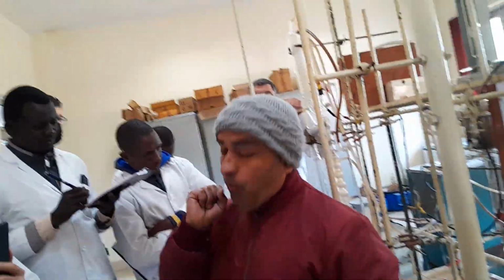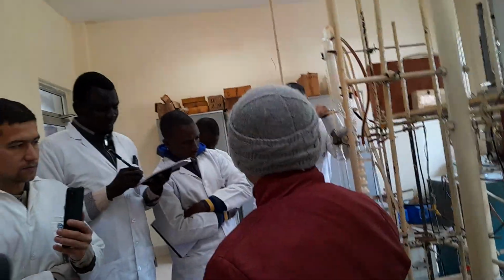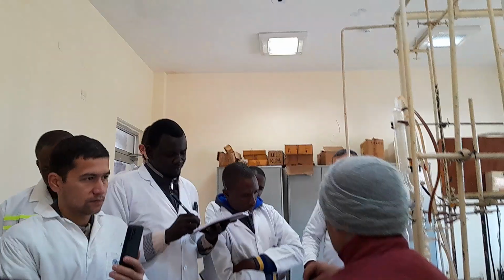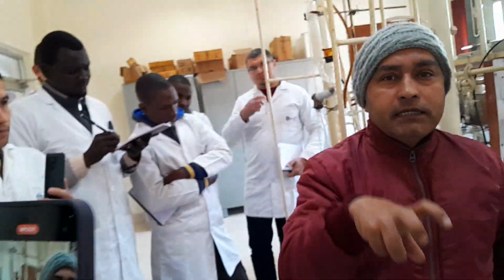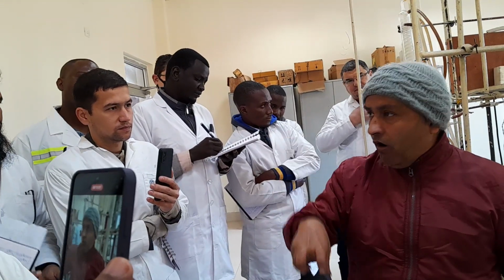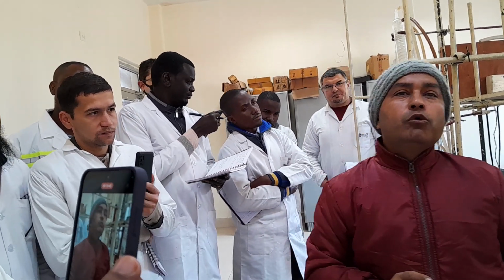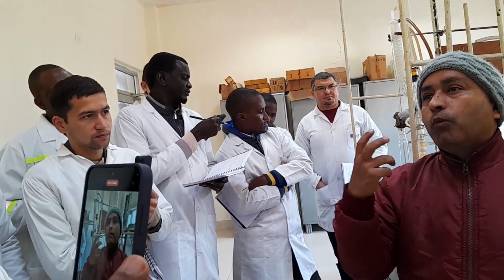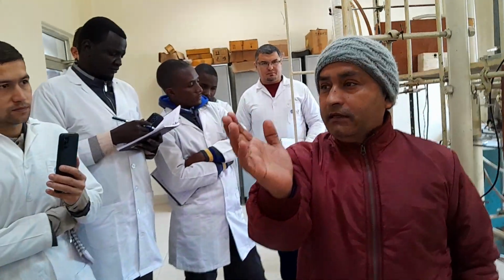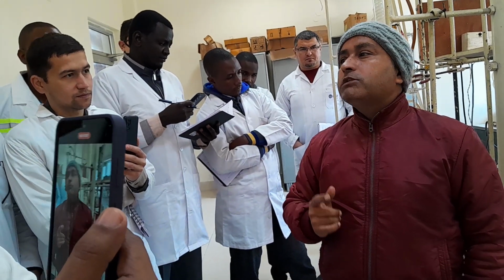Now, why is it so? I am taking a minimum of 1.5 liter sample and a maximum of 20 liter of sample. If you are distilling 20 liter of sample without knowing whether your crude oil is stabilized or not, then finally when you do the material balance, you will find your loss is more than 1%. So who is responsible when in the refinery, where trillions of crude oil are distilled, you multiply by 1%? How much loss will you get? Who is responsible for that?